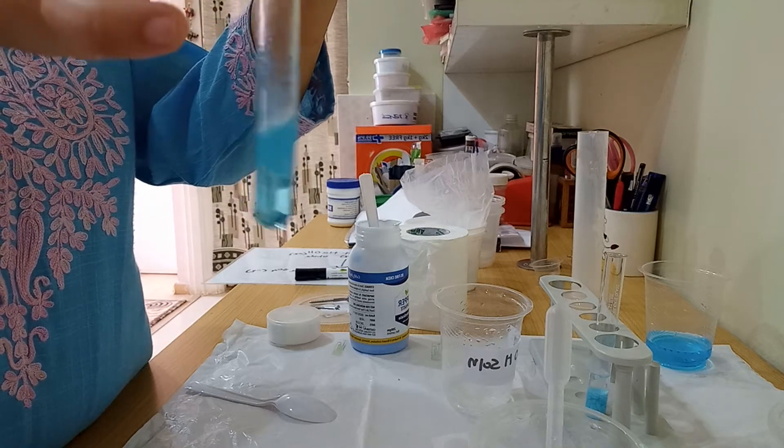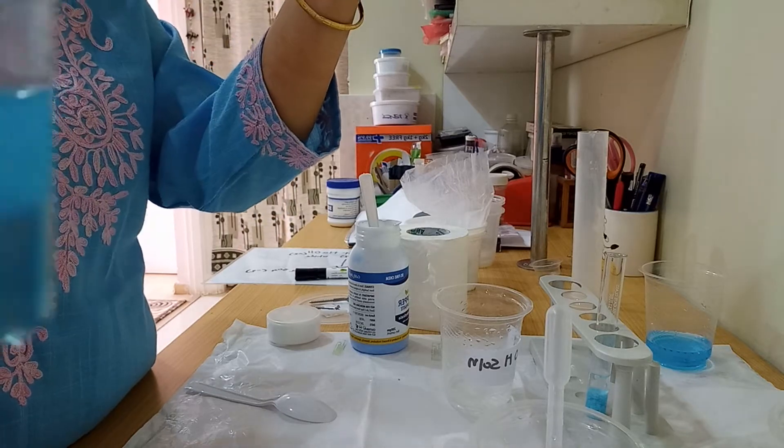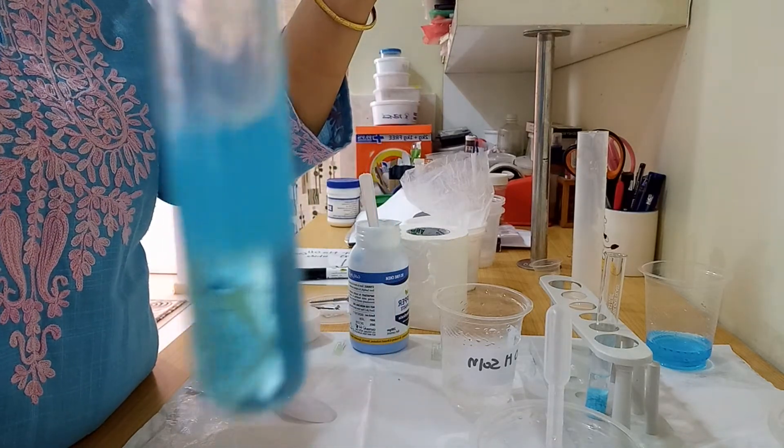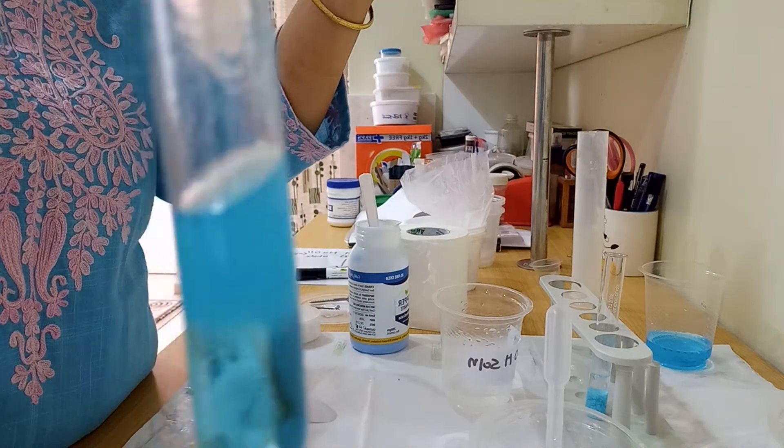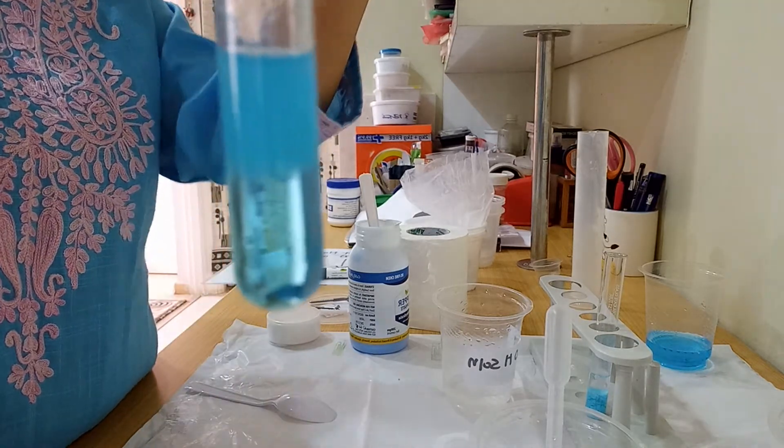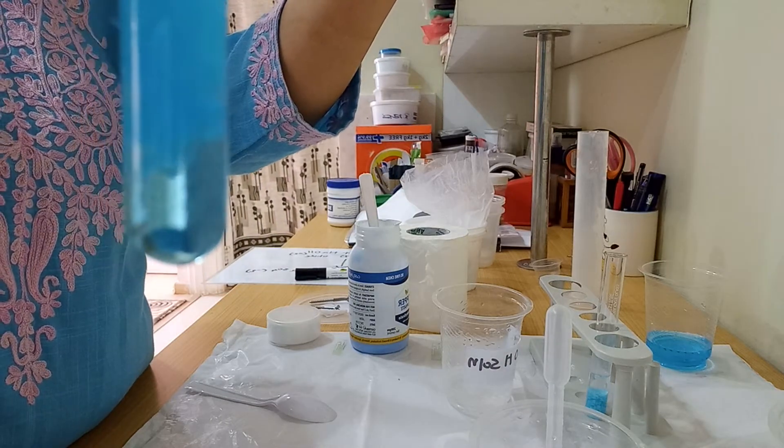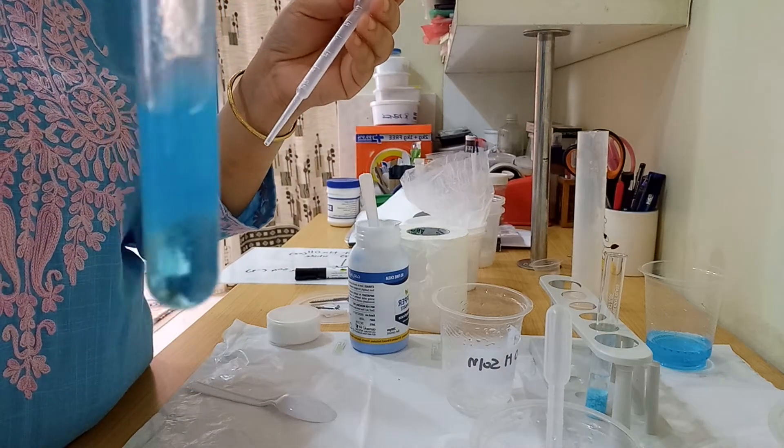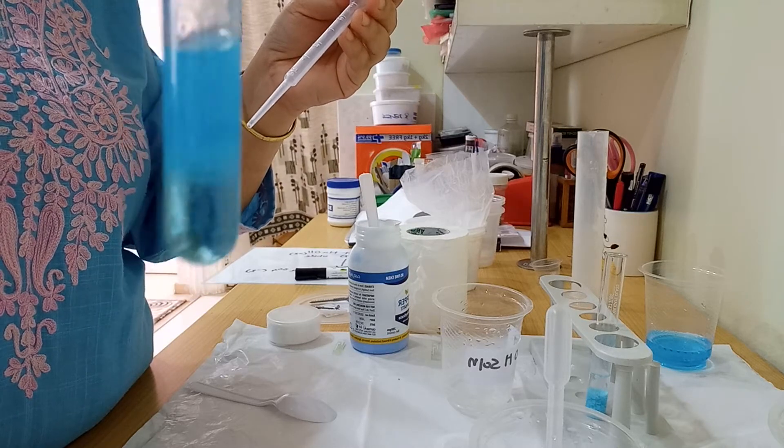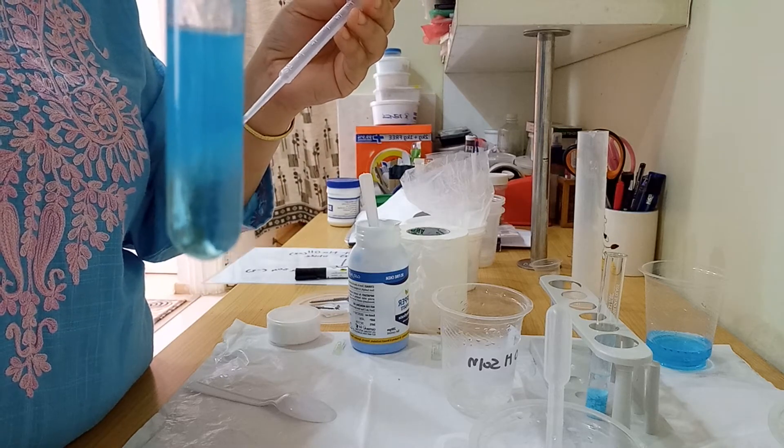What is happening? Can you see it? You can see some precipitate is forming. This is called a gelatinous precipitate.